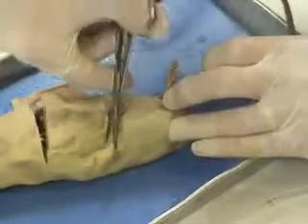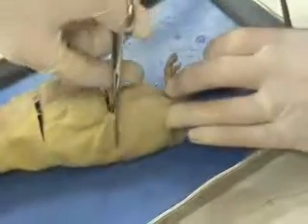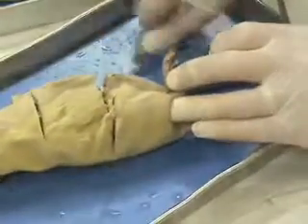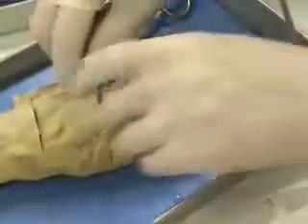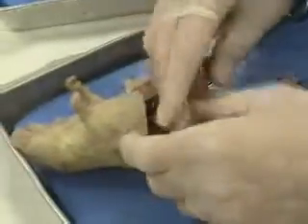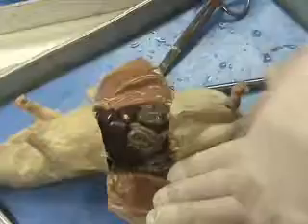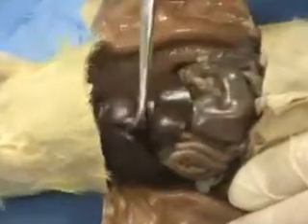As you're cutting the muscle part, be remembering some of the structures that we talked about yesterday. We had the pinnae as the ears, the vibrissae, and being able to figure out whether it's male or female. Now, on the inside of the rat, a few things that we're going to identify in the abdomen section here. Right here we have the liver.